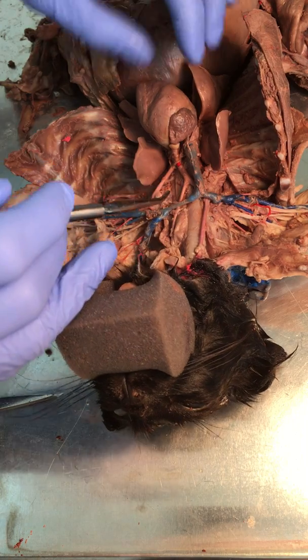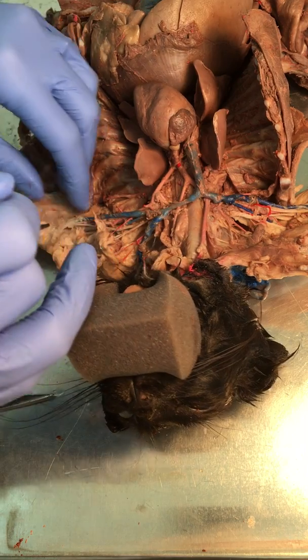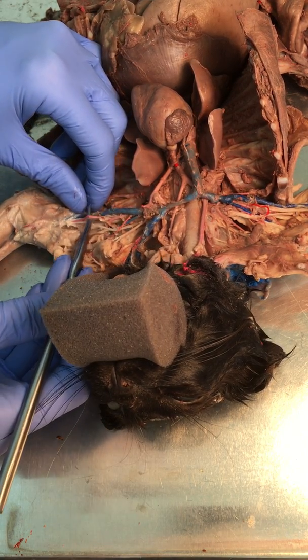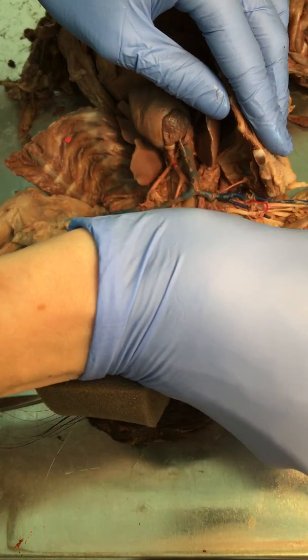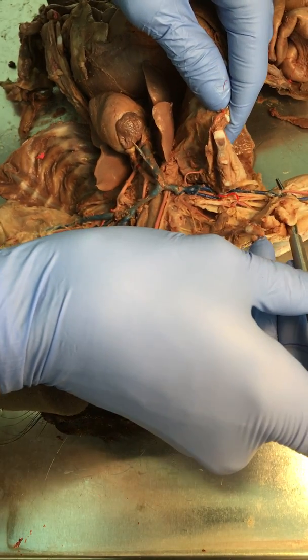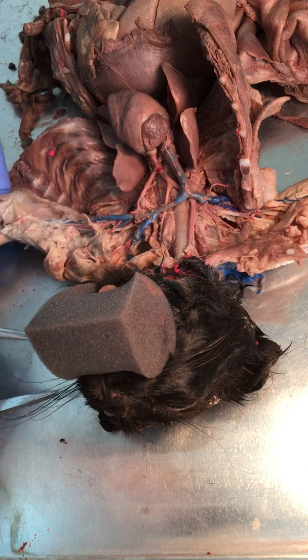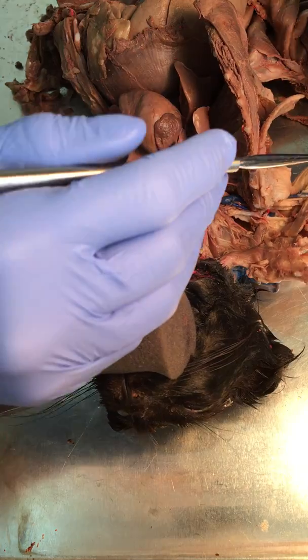If we go ahead and go next, just like our study guide says, we're going to look at arm arteries. And so here you have your brachial, just like you would have over on this side. I'm just making sure that you guys can see this. All right, so as this continues down into the forearm, you would have the radial and ulnar.